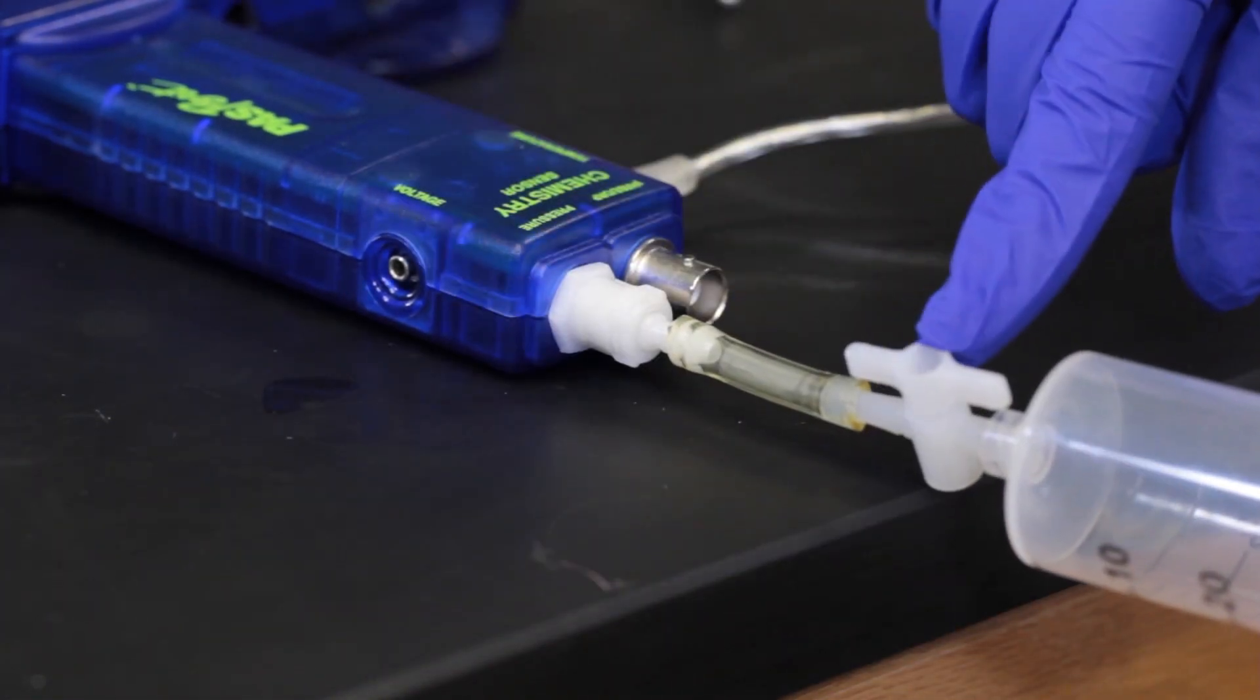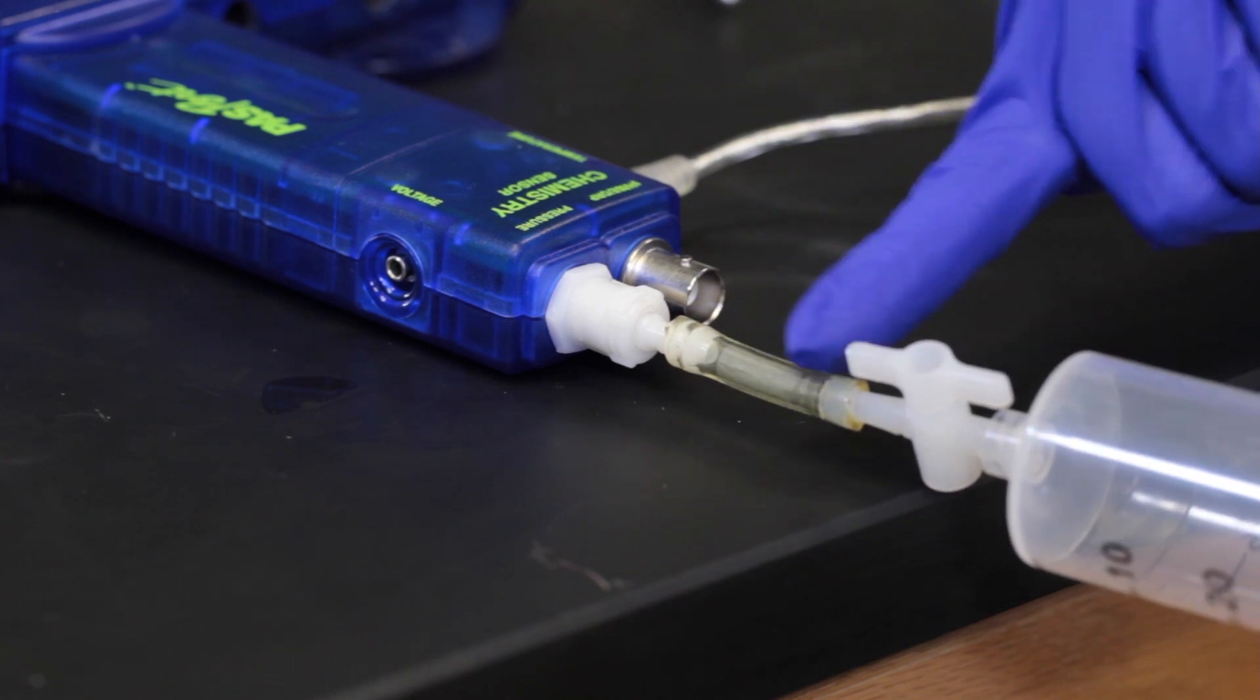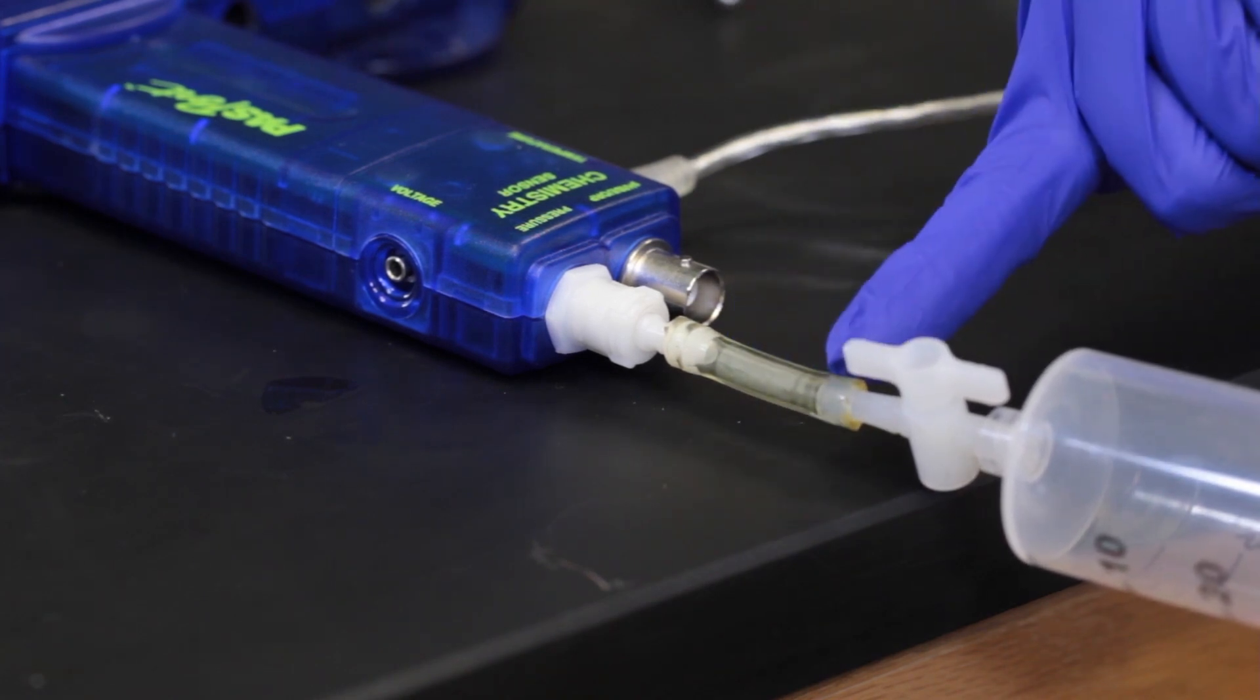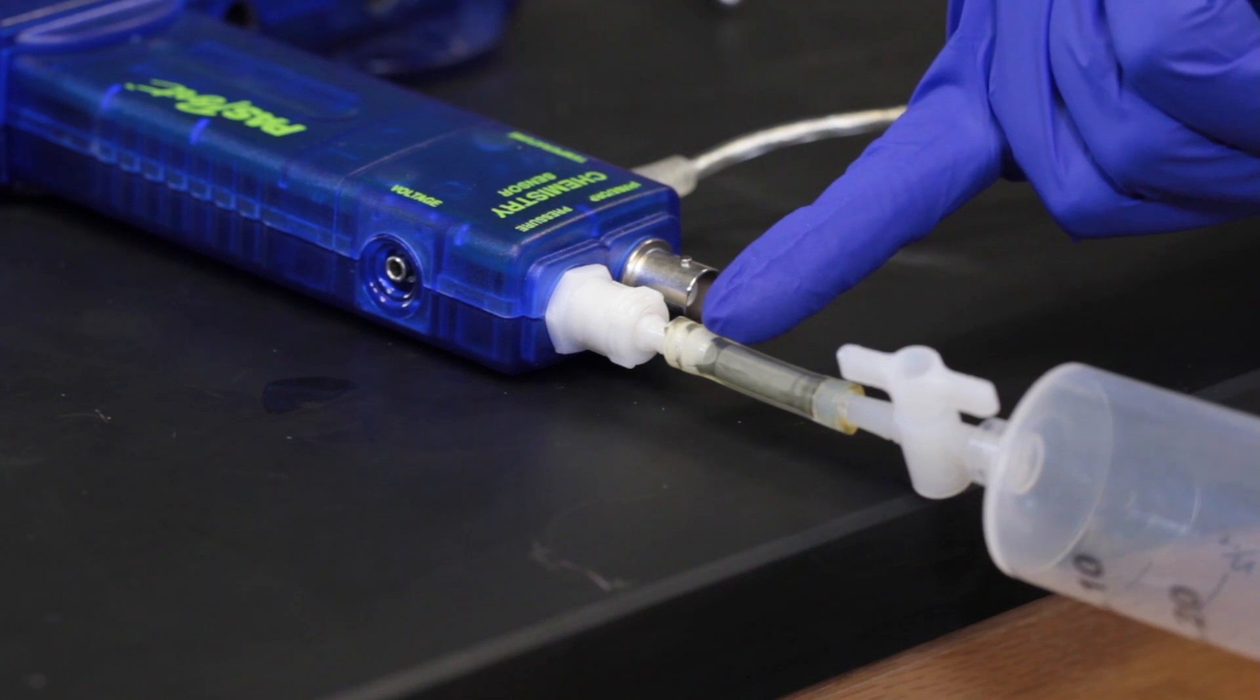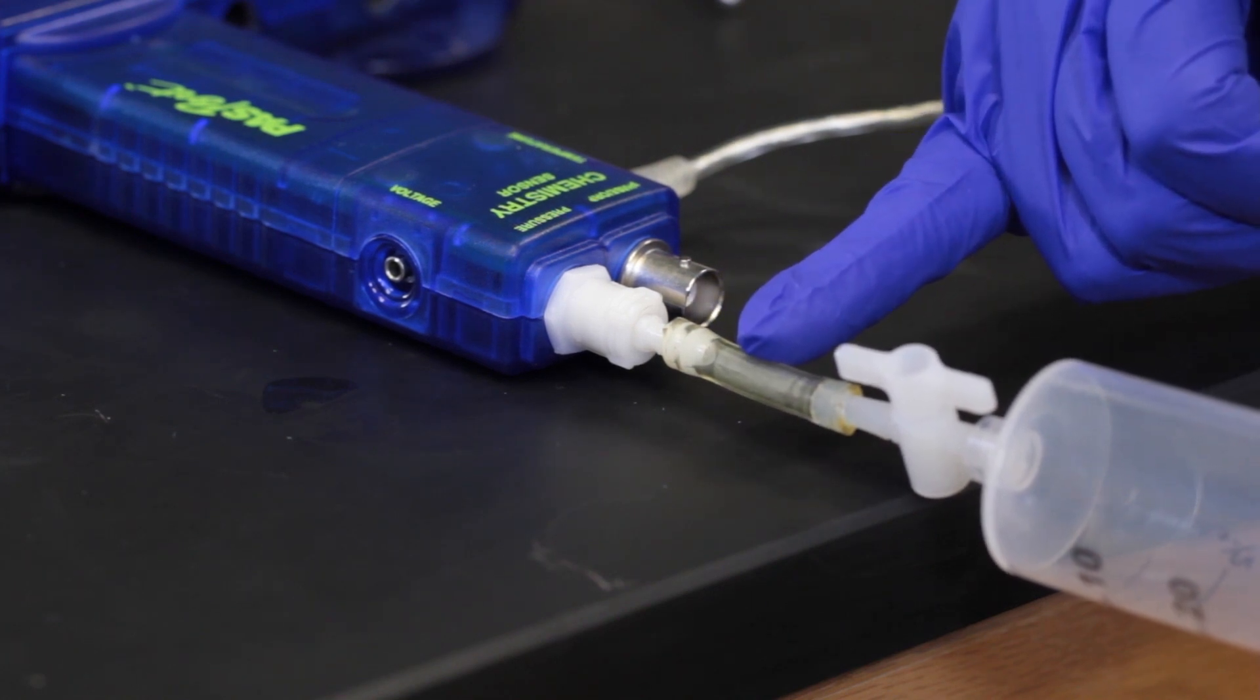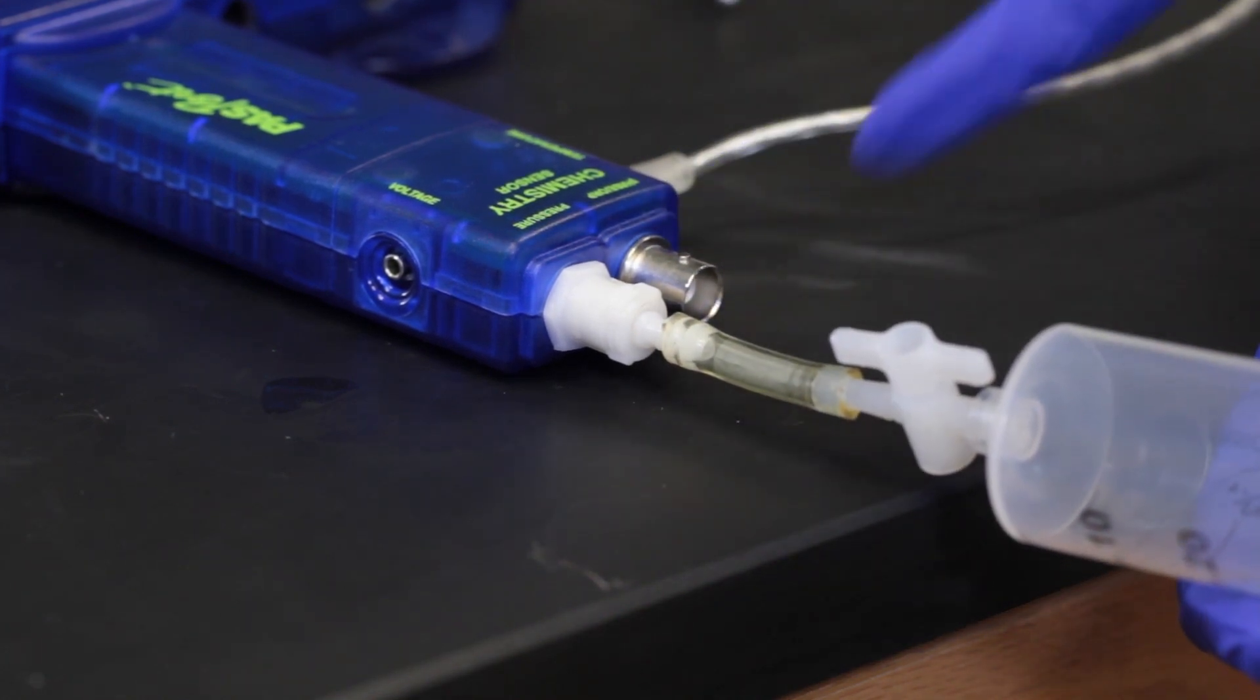I want to make sure that this is open. If this is closed, that means I'm only measuring the pressure in that piece of tubing. One of the reasons we have this as short as possible is so that we are having a negligible volume here that doesn't mess with our calculations.